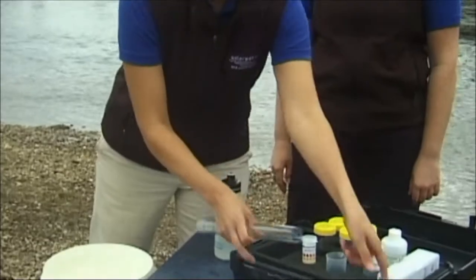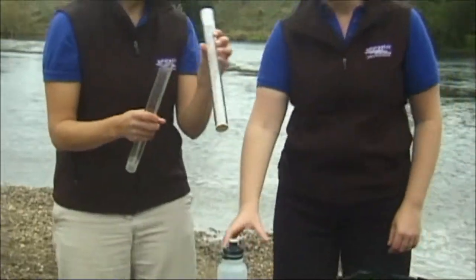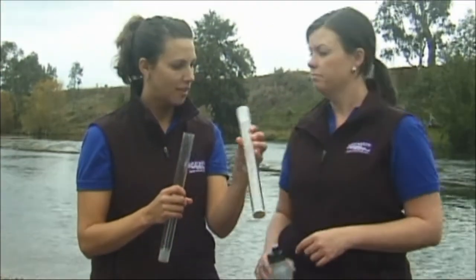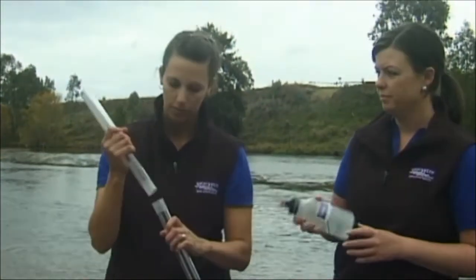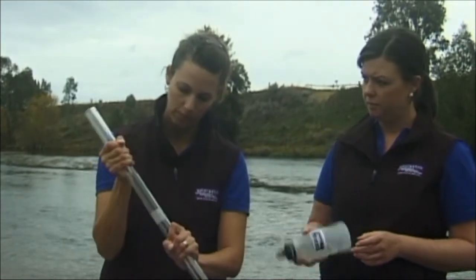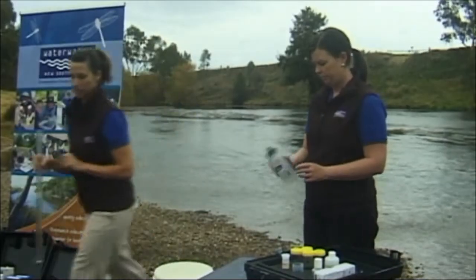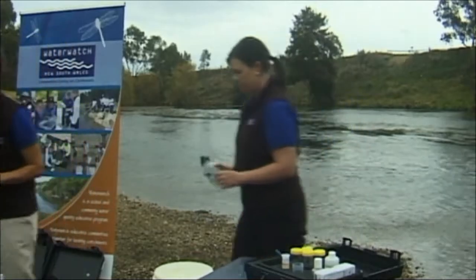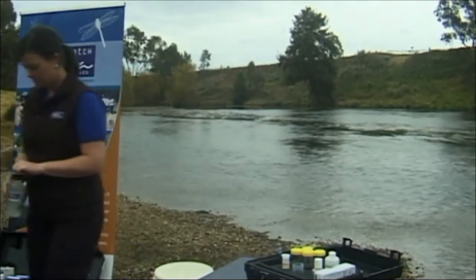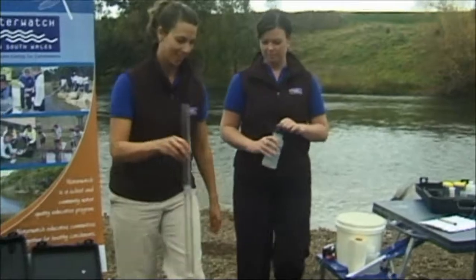Assemble the turbidity tube by sliding the two pieces together. Look for the white disc with three wavy black lines on the bottom piece. When it's sunny you need to conduct the test in the shade without your sunglasses and in the shadow of your body. But we don't have to worry about that today.